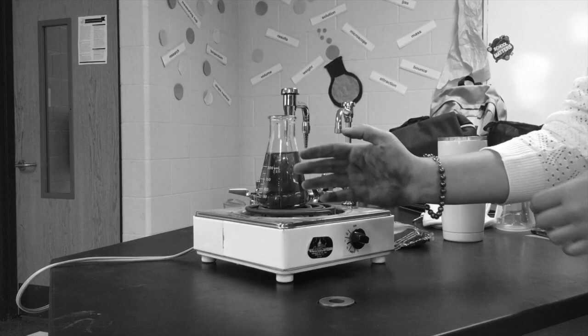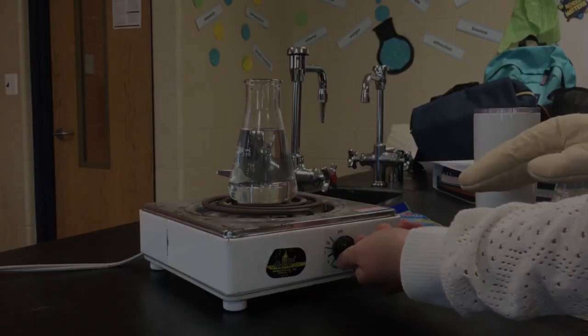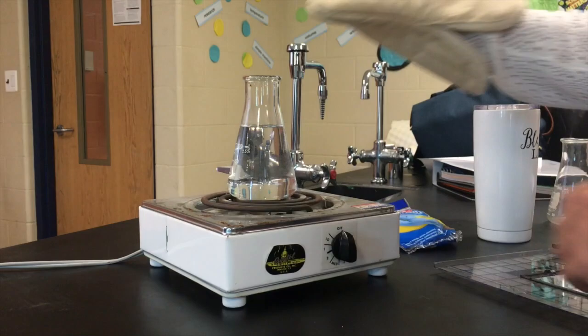Have you ever scarred your hands from handling scalding hot glass and metal? By using tongs or heat-protective gloves, your hands will be as beautiful as ever.